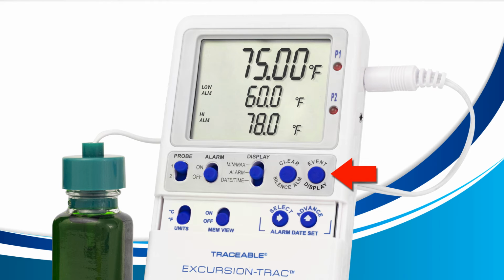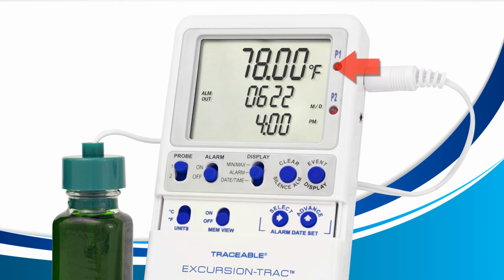With that in mind, let's press the event display button once to learn about alarm out. The alarm out is when your current temperature either exceeded your high alarm or fell below the low alarm. In this case, the top says 78 degrees Fahrenheit. So this means that my temperature exceeded my high alarm of 78 degrees Fahrenheit.